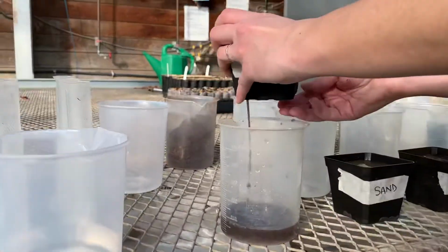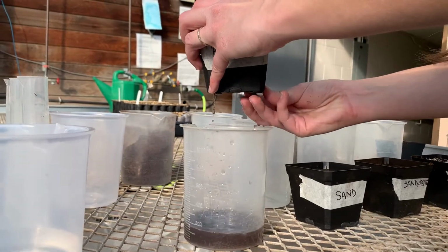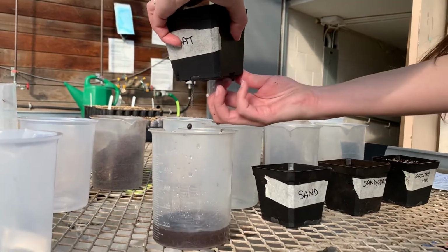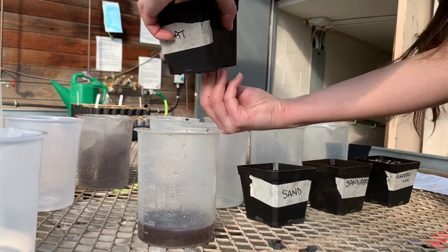And this may take a few minutes to get everything off of there and let it drain. You can do that, should have done that before we started recording, but that's all right, you're along for the ride now.